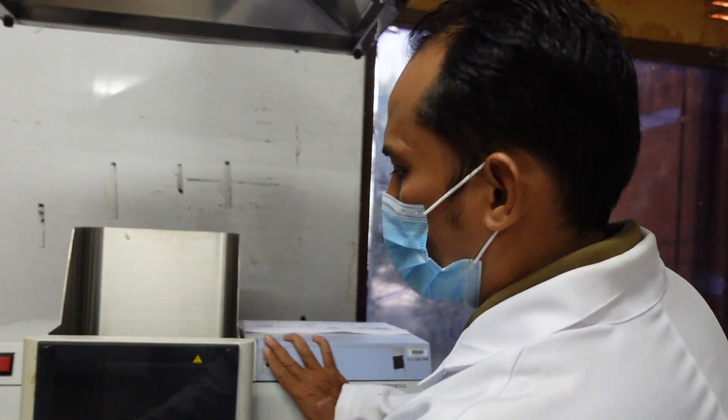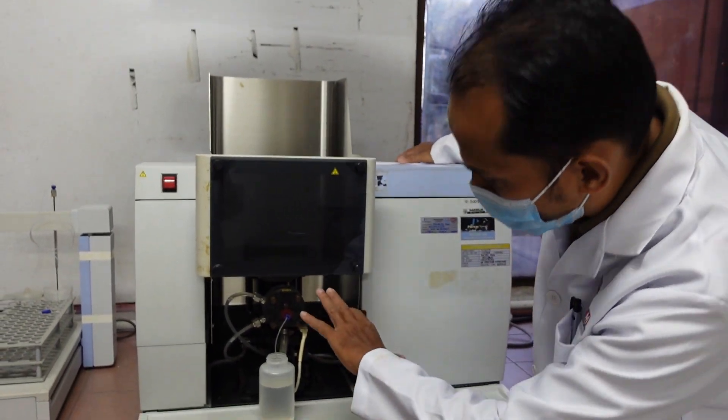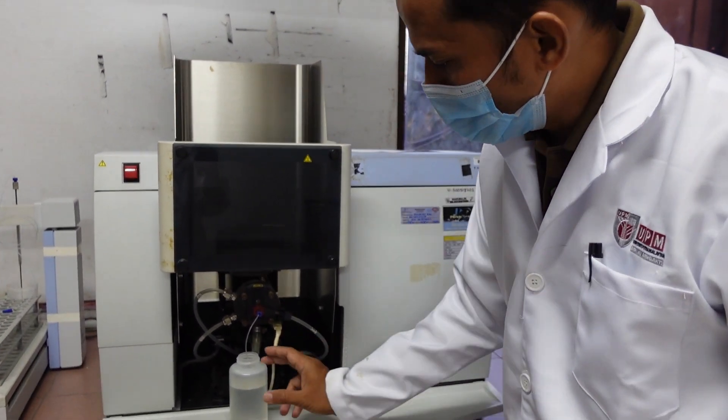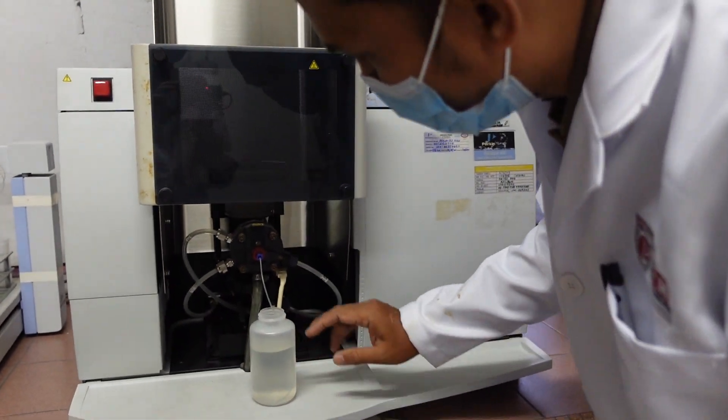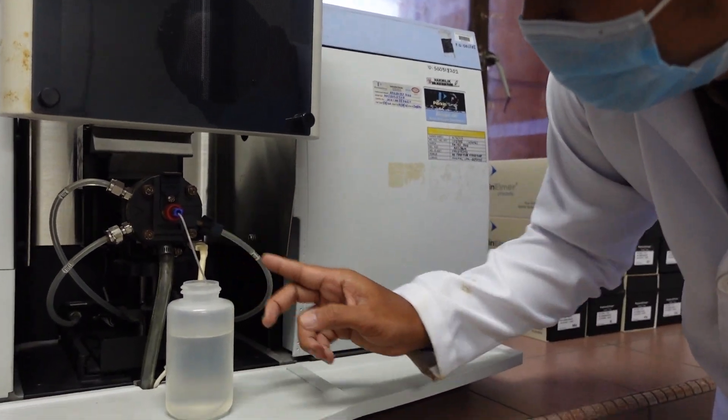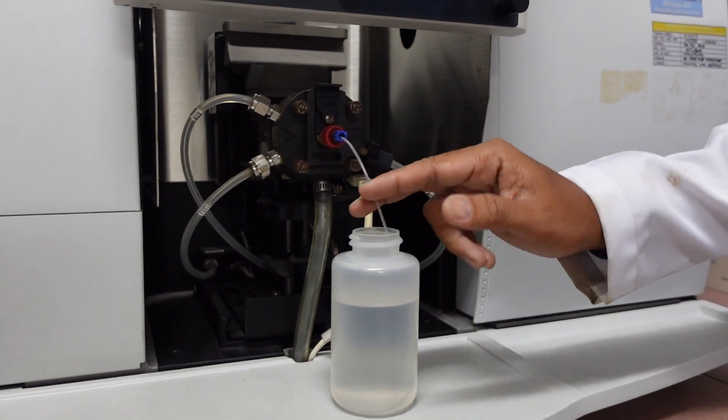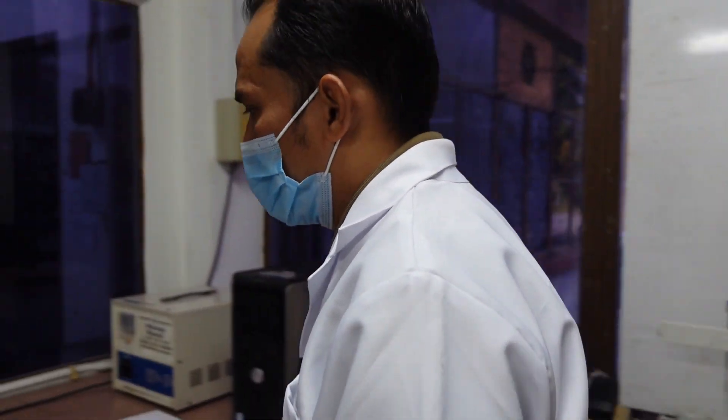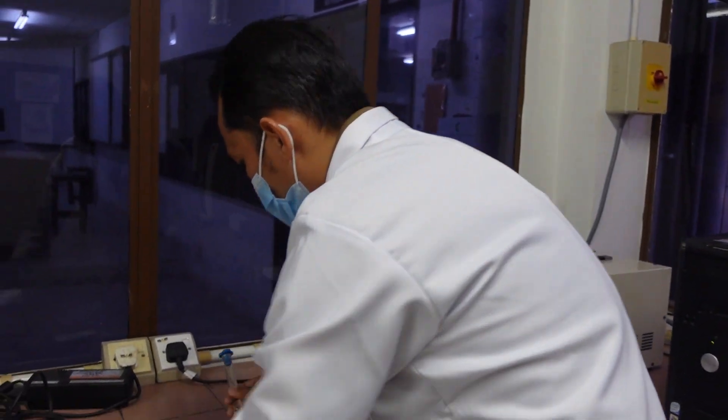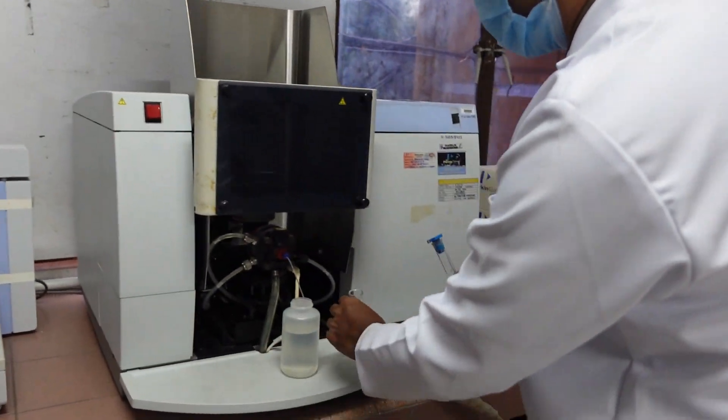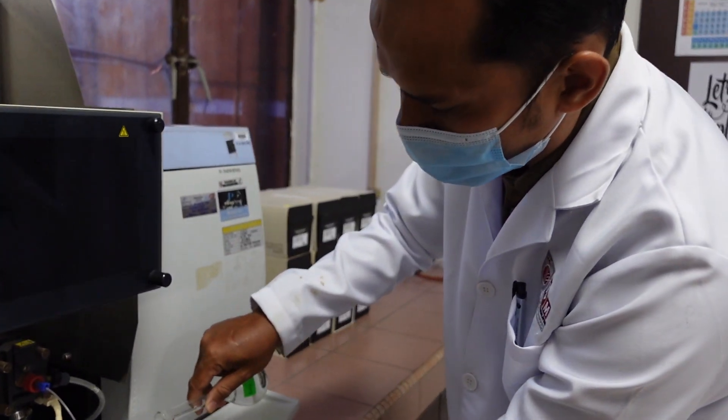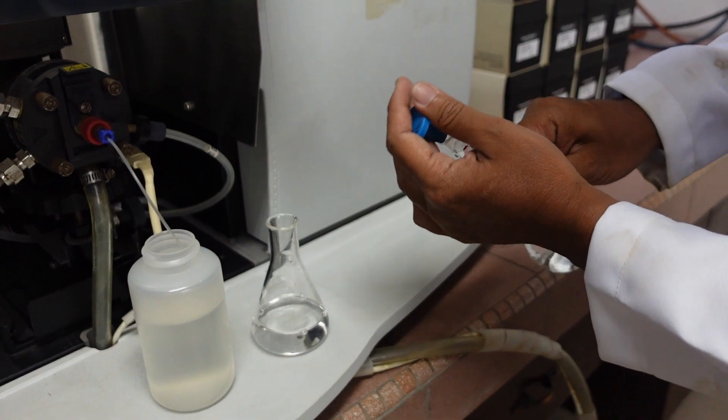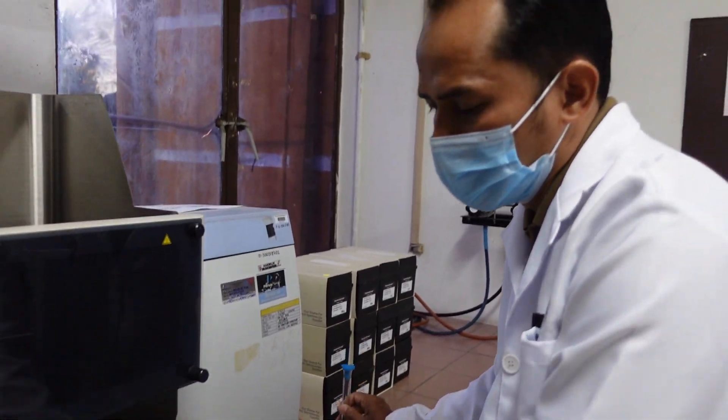I want to show you the nebulizer. This is where the burning process takes place. When you run the experiment, you can see they have a few tubes here and there. One for the fuel, and this is the sample tube. Imagine we are running the experiment. First, what you need to do is prepare a blank. You put your blank.